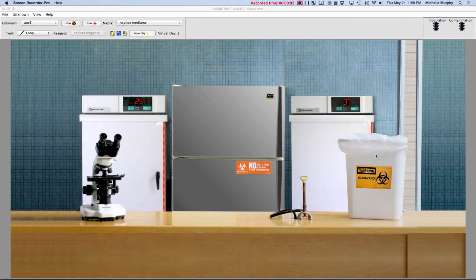When starting to use the virtual unknown program, one of the problems that people can encounter at some point is an error that says all microbes have been eliminated, and then it won't let them go any further. We'll look at that error and we'll see how to fix it in this video.